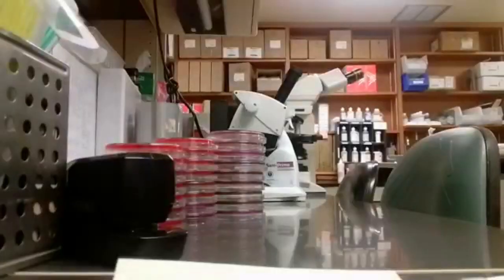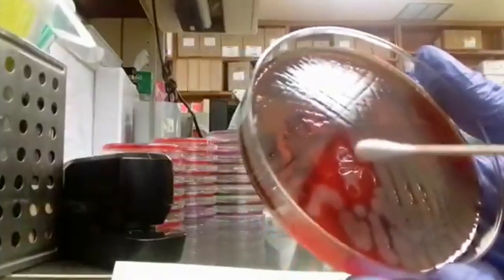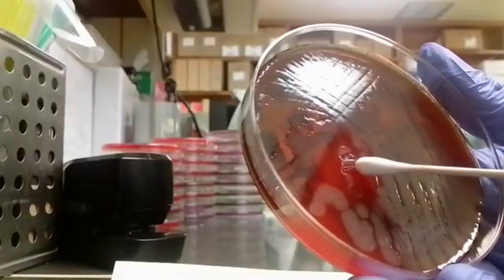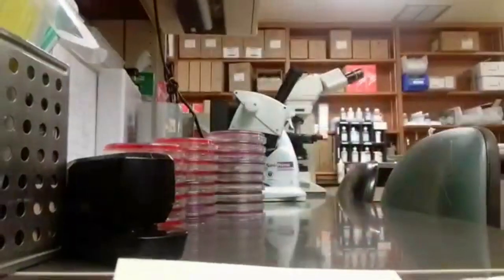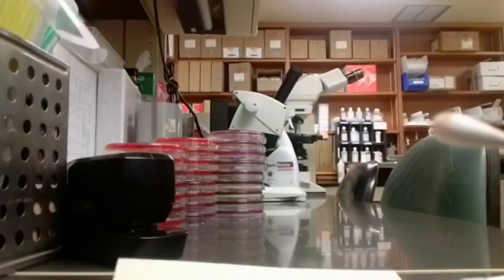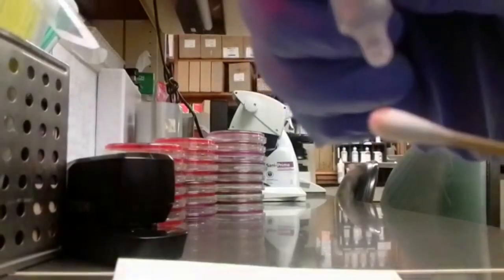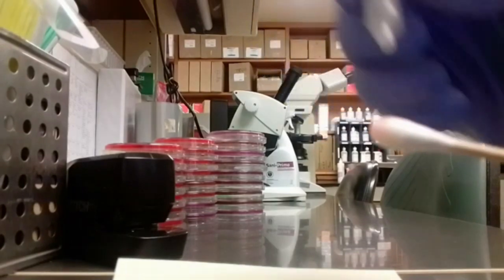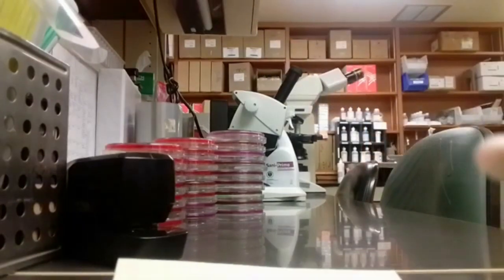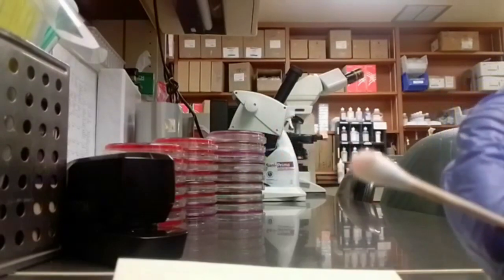Some things to keep in mind: you're going to want to take an isolated colony of a fresh, pure colony. If it's older or younger you'll get discrepant results, and if it's a mixed colony you'll definitely get discrepant results. Pick that up on your swab, add your oxidase reagent — just one drop — and then you'll see that purple color change.